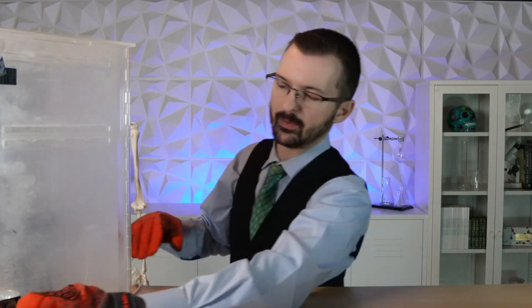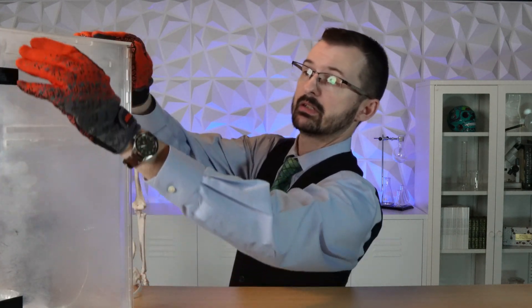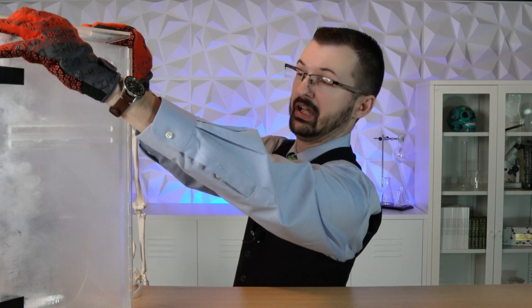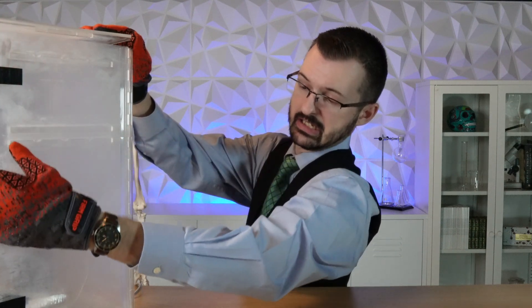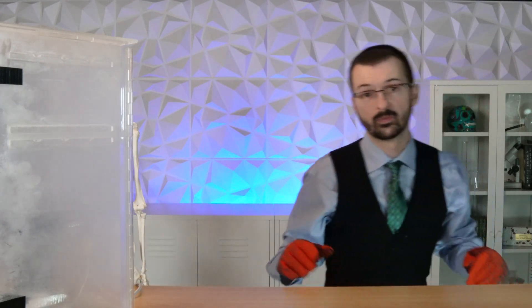We should be close to the baking being done — I kind of feel like we've got an easy bake oven going on. So let's open this up and vent it. Let's vent out the top. And we're going to step away and let that vent for a minute — or 10.